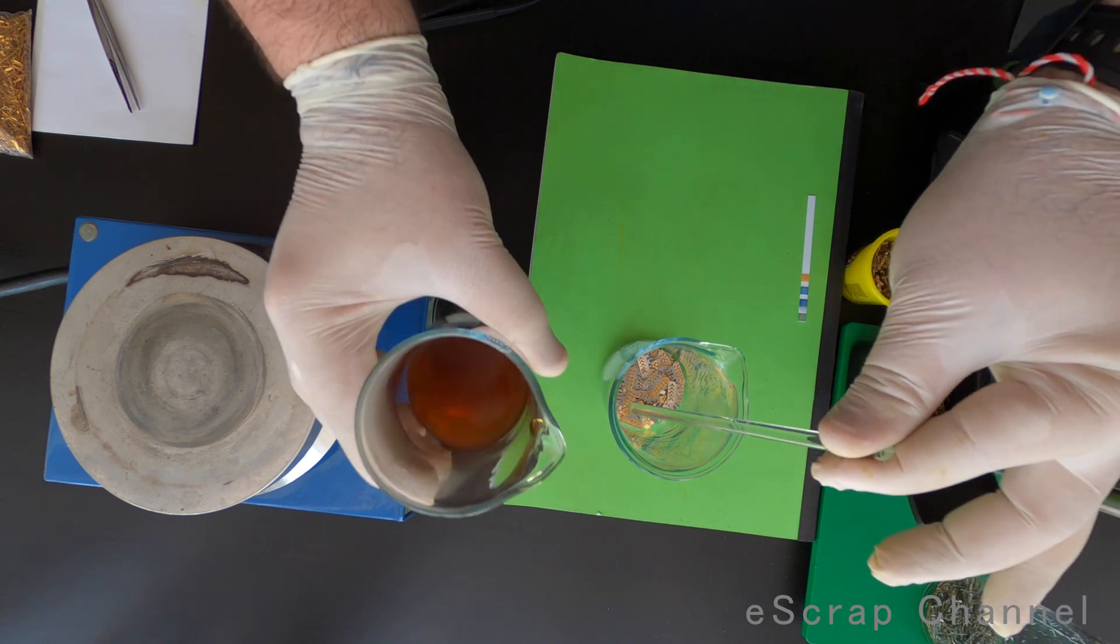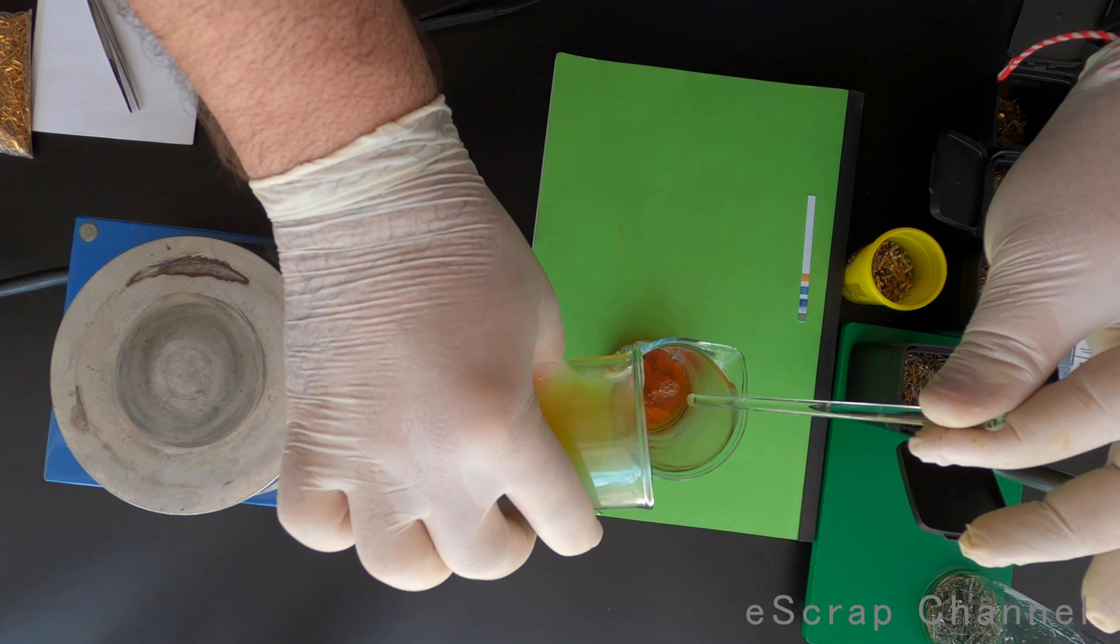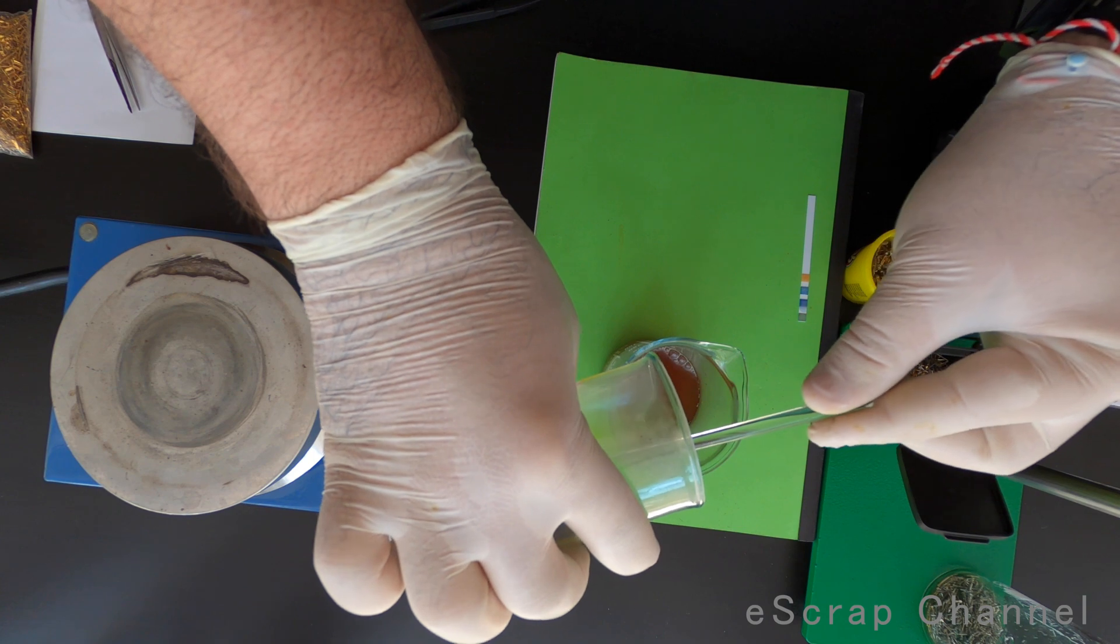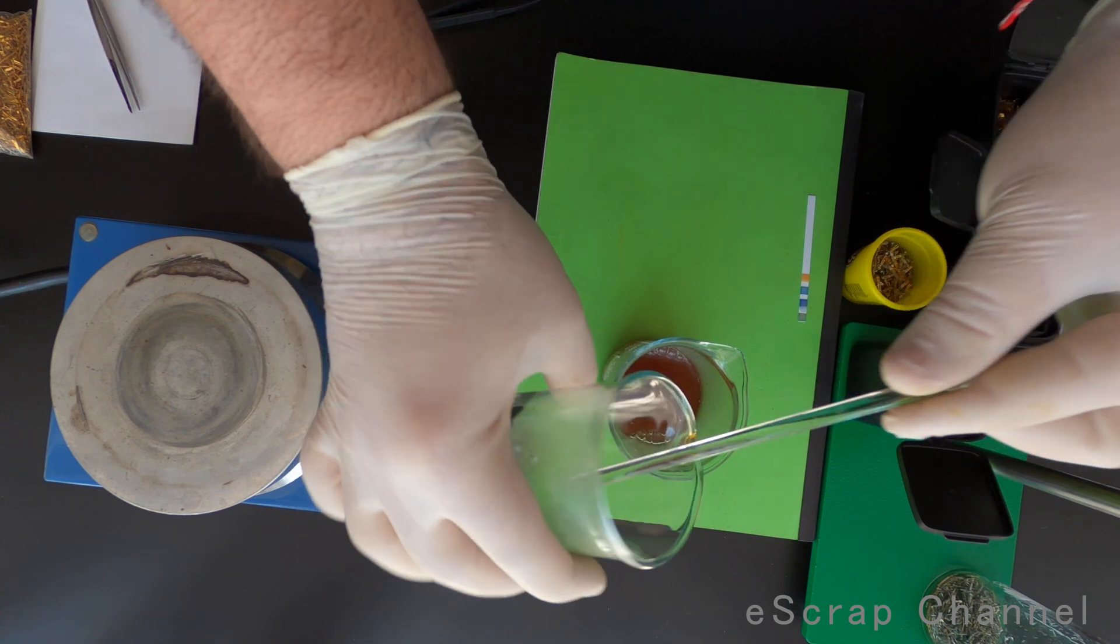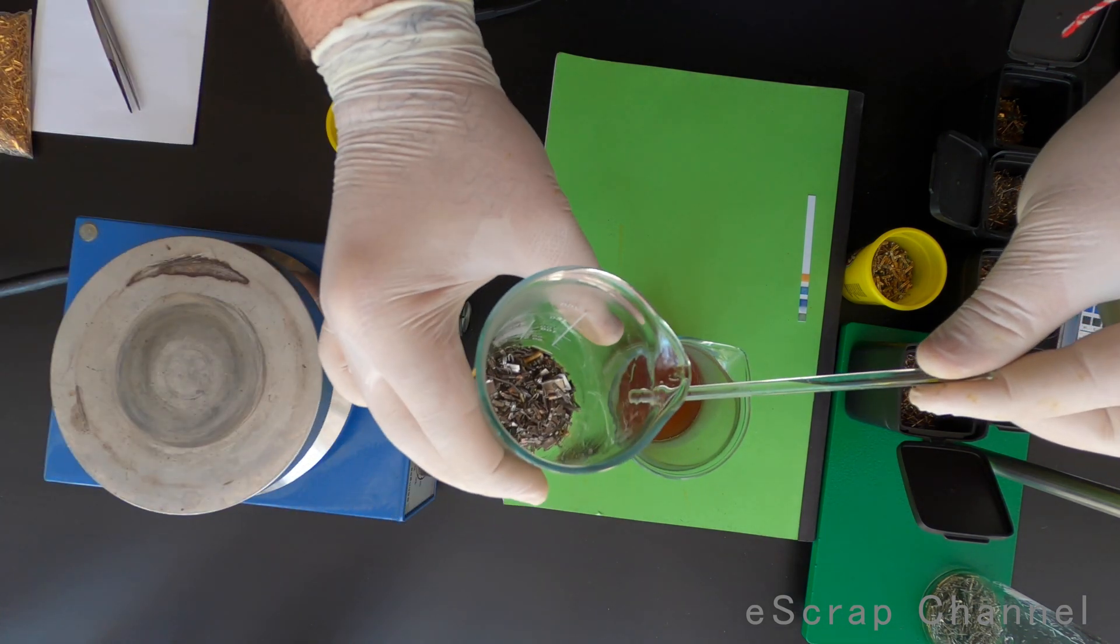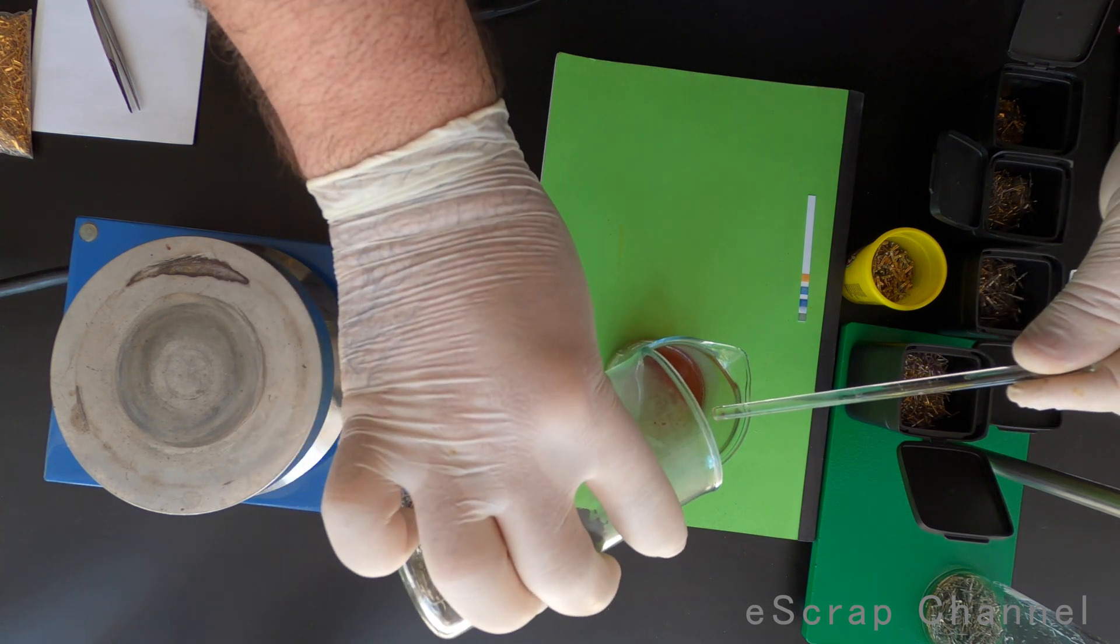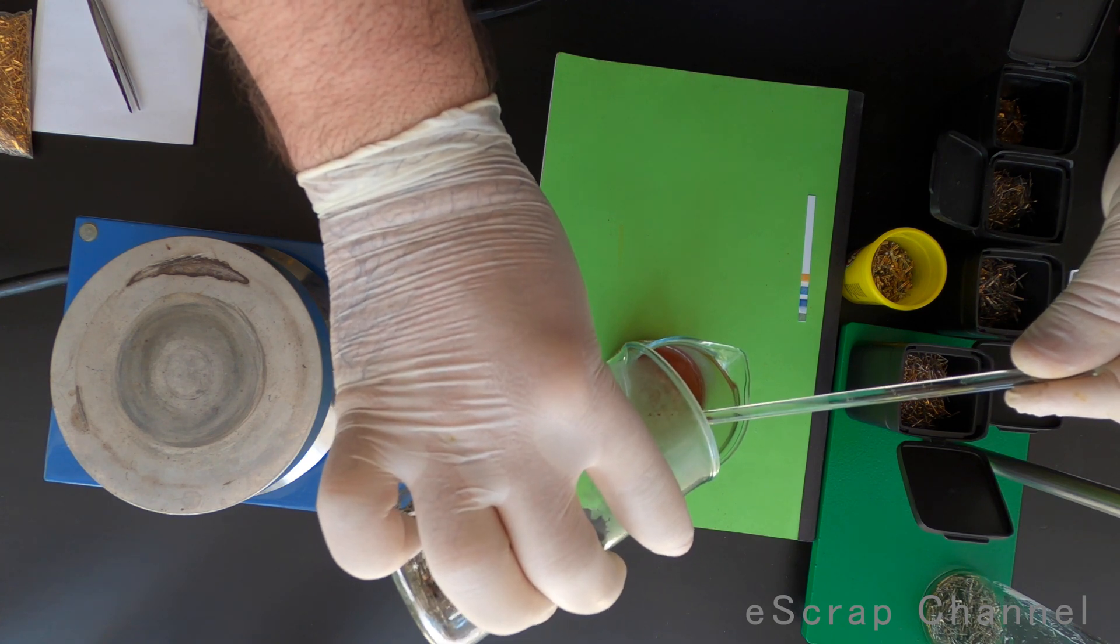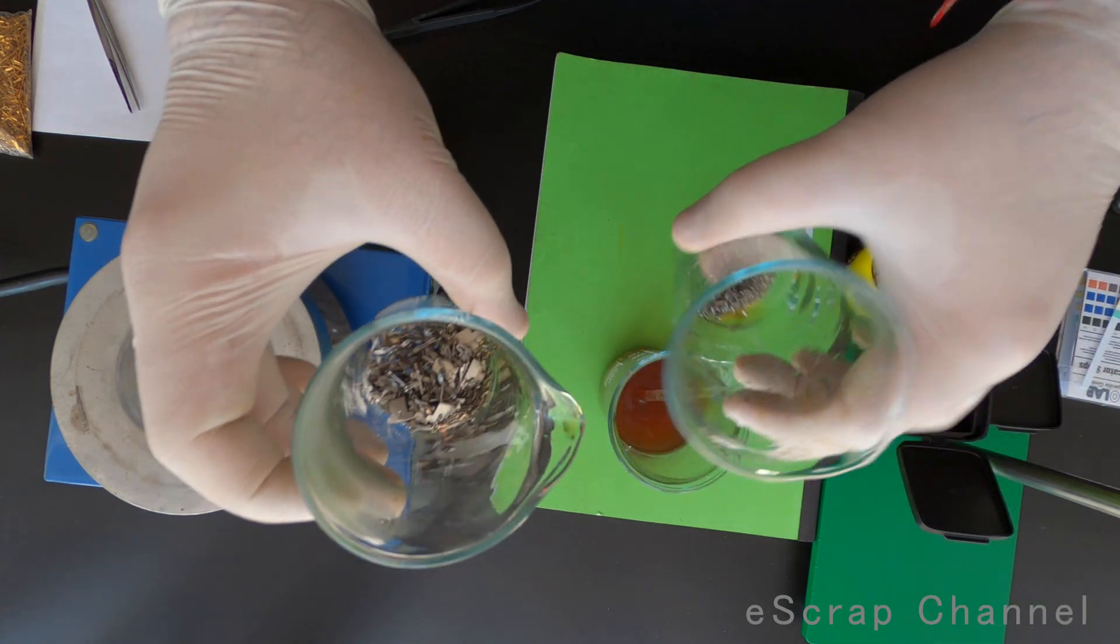Just to be sure that I will have the same reaction for each batch that I process. I'm pouring this solution into the next beaker. And let's see what we have here. Clean pins. That's great. Maybe I waited too long for this one.